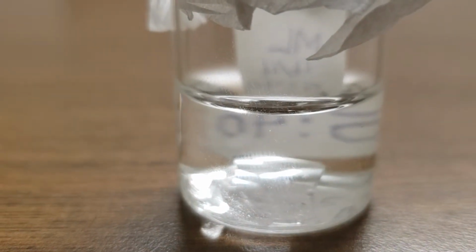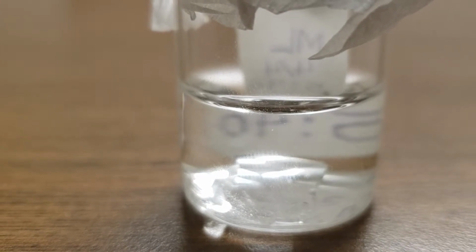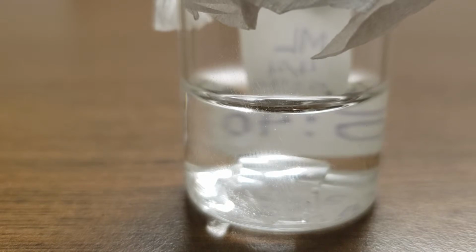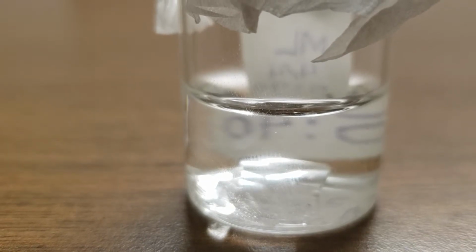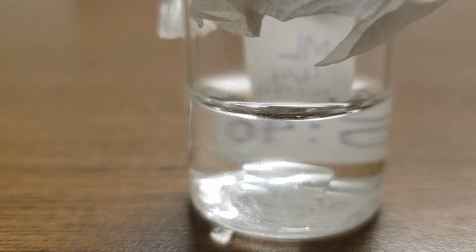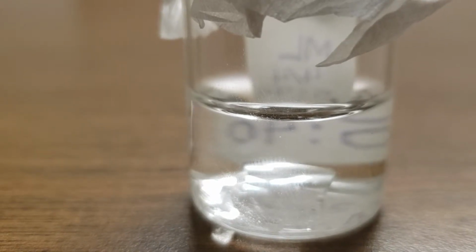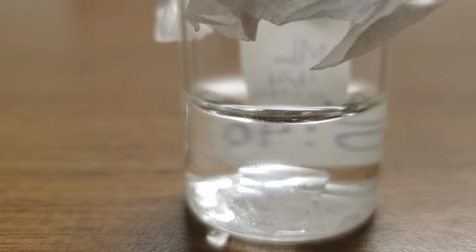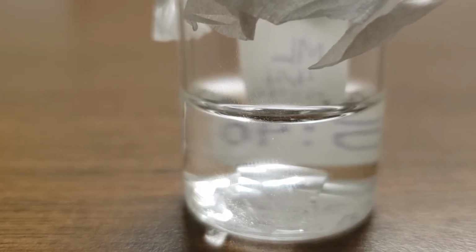Much of the water from the solution has evaporated. The environment my single large crystal grew in was for the most part dark and cold, as the lights in my room are usually low and the temperature no more than 70 degrees Fahrenheit. However, although I have a large crystal, it isn't necessarily high quality because there is some cloudiness at the bottom of the vial, and there is a second smaller crystal.